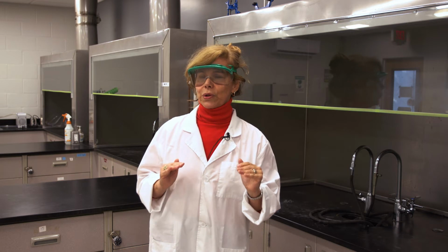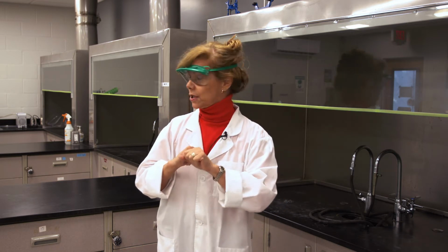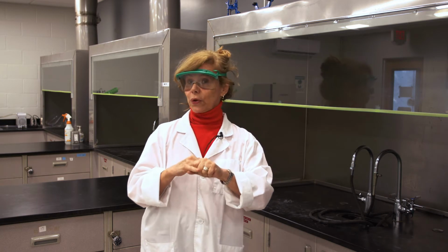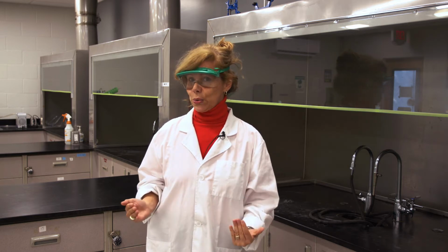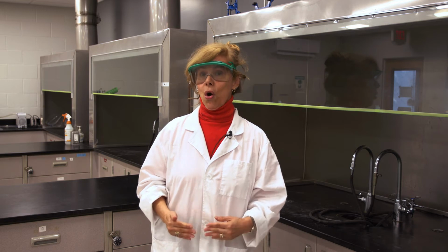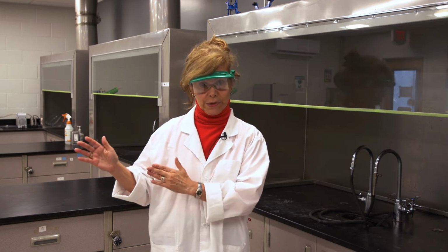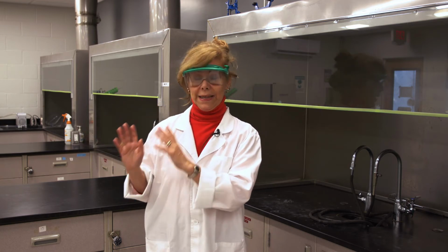Another thing that is important: I already talked about solvents and flammability, no flames and no fumes, so always in the hood. The other very important factor is how we dispose of the waste after we do an organic reaction. In every experiment there will always be designated waste containers, bottles labeled accordingly.